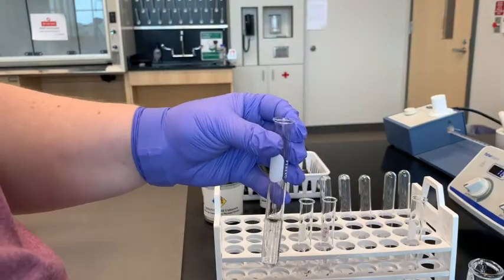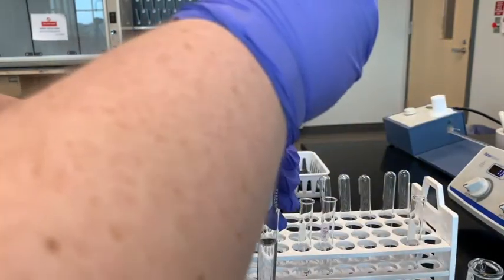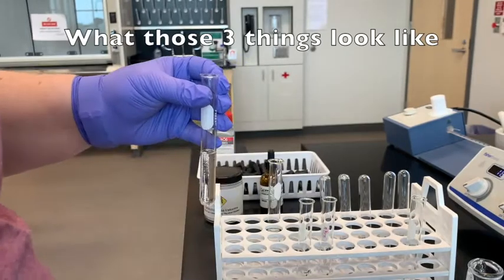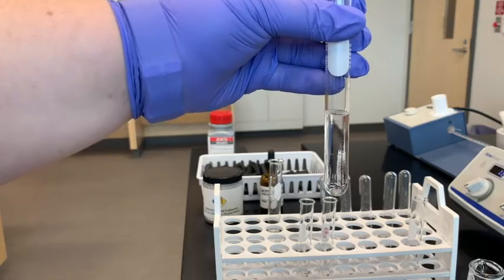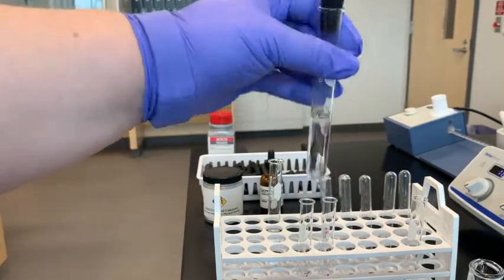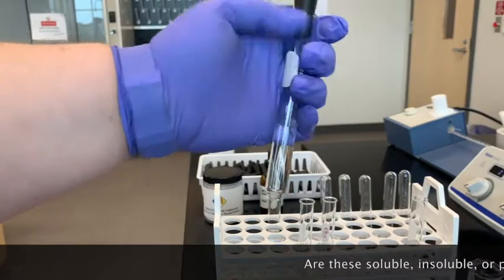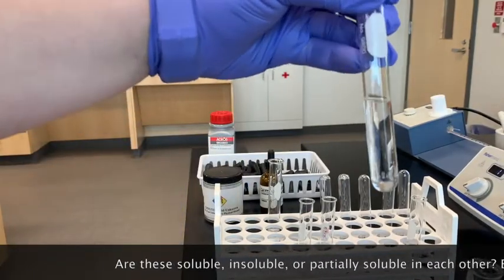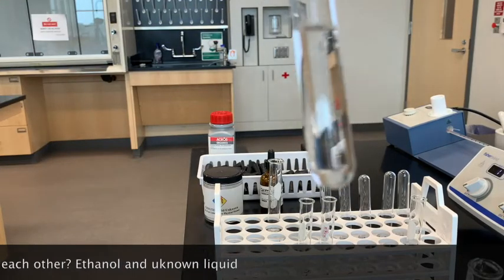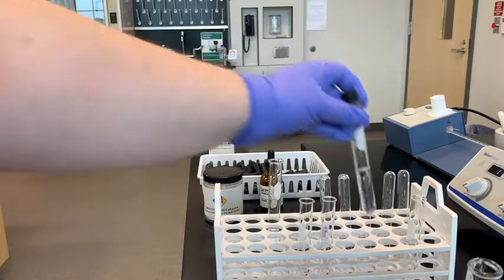Think about what it's going to look like if you have two liquids that are soluble in each other, insoluble in each other, or partially soluble. I've now added my ethanol — it's not mixed up very well. I'll stopper it and shake it up. Make sure you shake it away from your face so you don't build up pressure. Looking at it now, I'm seeing just one continuous liquid.